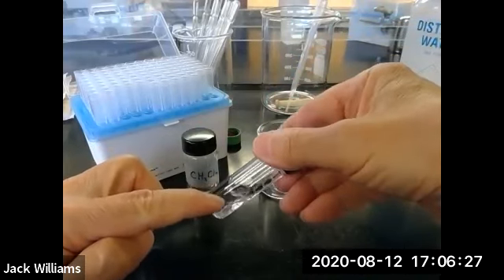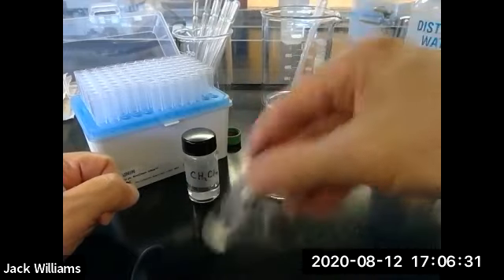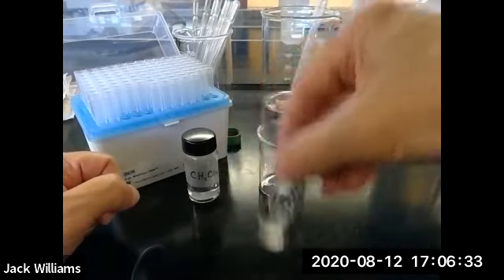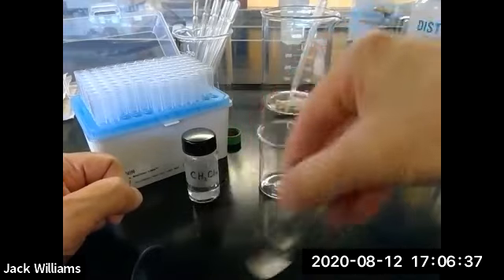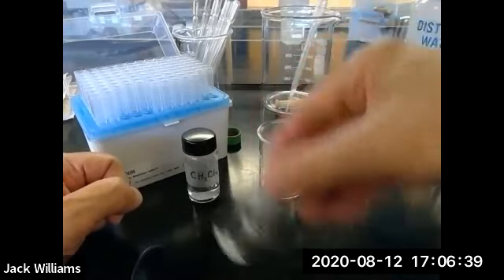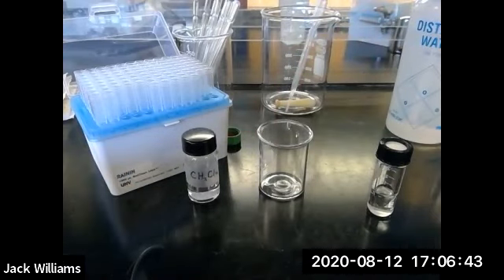See that? Not a drop, a crystal in the bottom. I can still see that crystal. Swirly, swirly. Until all the benzoic acid has dissolved. I'm going to pause the video so you don't have to sit there and watch it for 5 minutes.